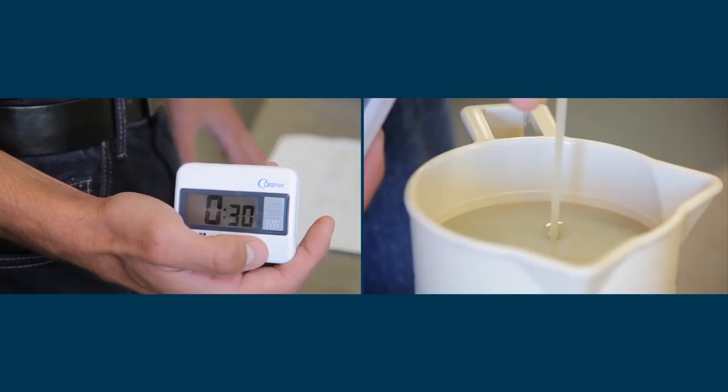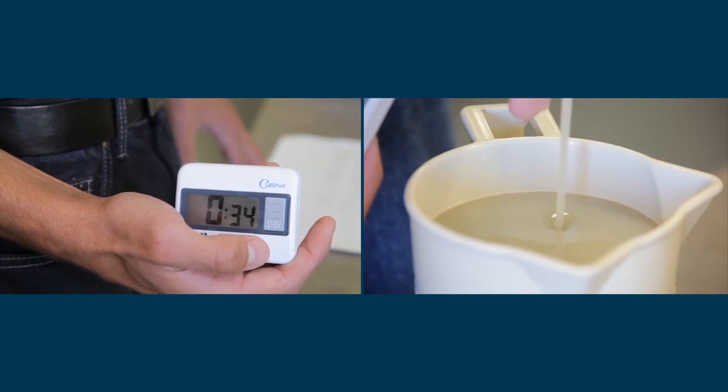Drilling fluids will take longer than this, and depending on the viscosity, could take anywhere up to a minute or more. The thicker the drilling fluid, the longer it will take.